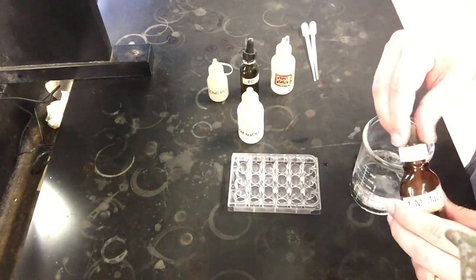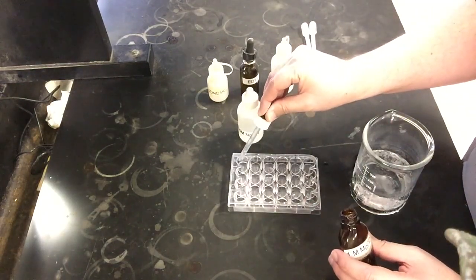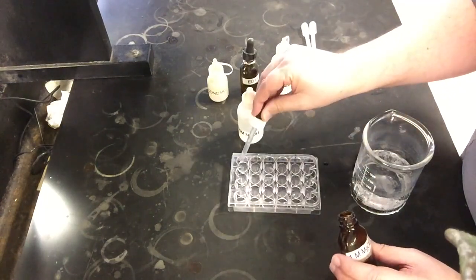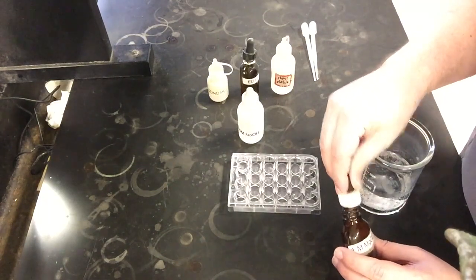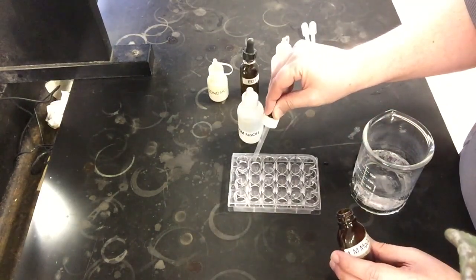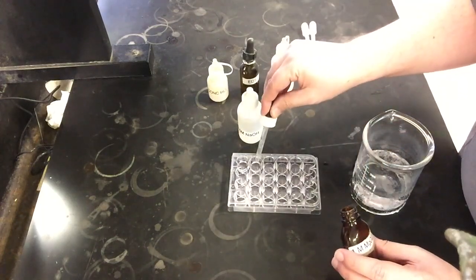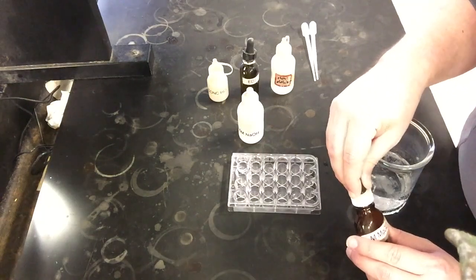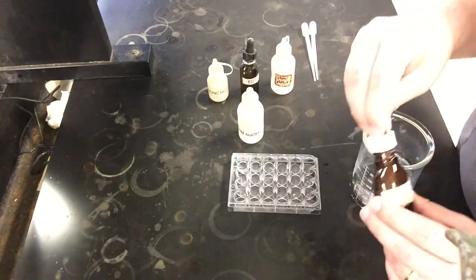So I'm going to add some magnesium chloride to each of my wells here to get started. And then after I've done that, I'm going to add sodium hydroxide to each of them. And hopefully what we should see is a white solid precipitate form. That white solid precipitate that forms when we mix these two should be our magnesium hydroxide solid. And then our other changes we can use to help us figure out what's happening to our equilibrium.